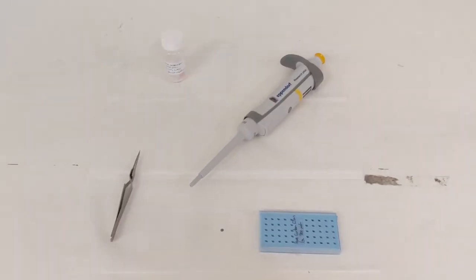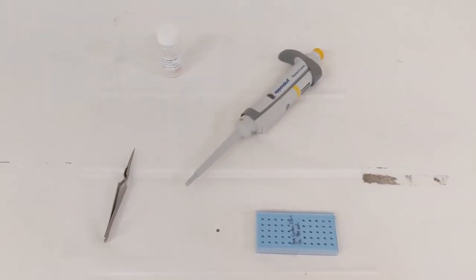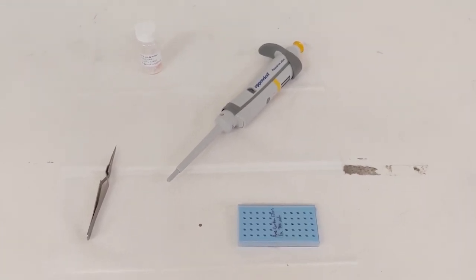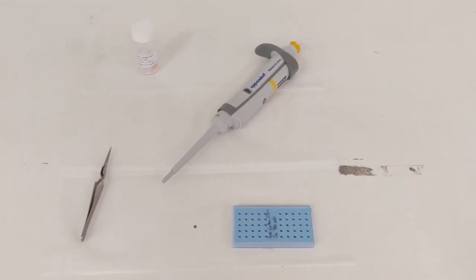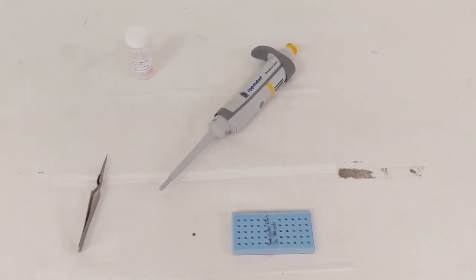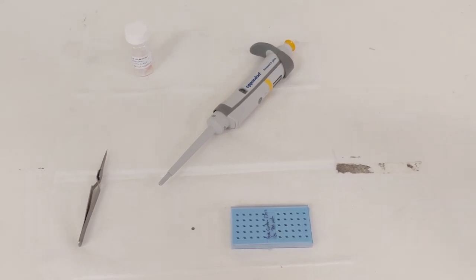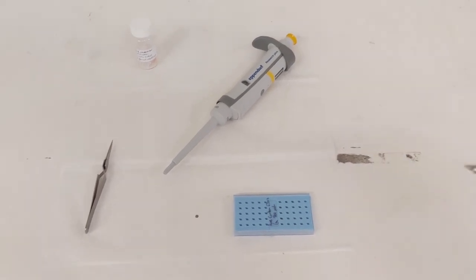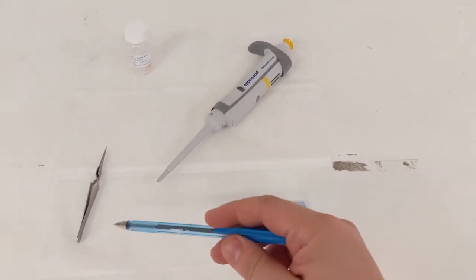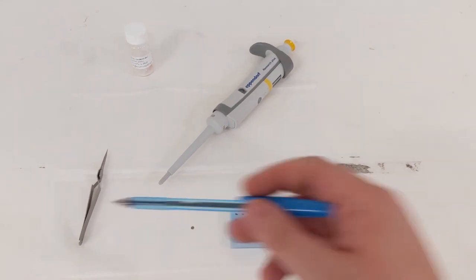We will also need a pipette to measure out a small quantity of solution — roughly 20 microliters — and we're going to use that to drop it onto the grid. And while we do that we will hold the grid using our self-closing tweezers.